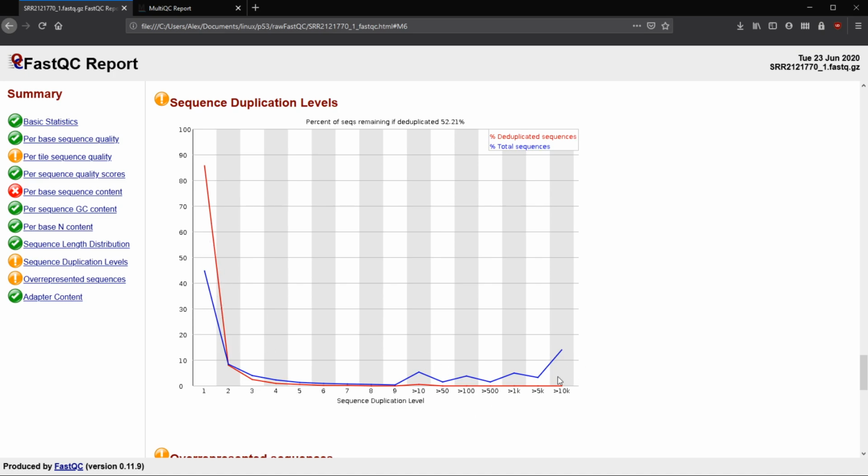So the higher expressed, more abundant mRNA may be here after PCR. So that could be something to pay attention to if you're getting these peaks for DNA sequencing, but for RNA, it's something to keep in mind, but kind of expected. Here, a warning is going to happen if a sequence is more than 0.1% of all sequences.